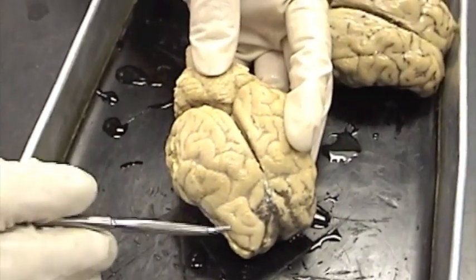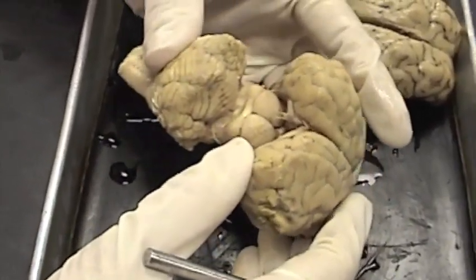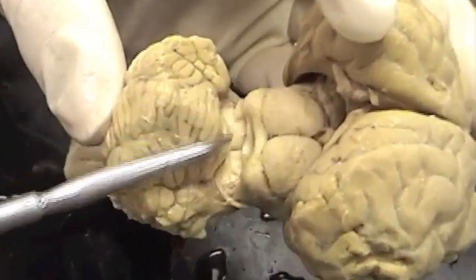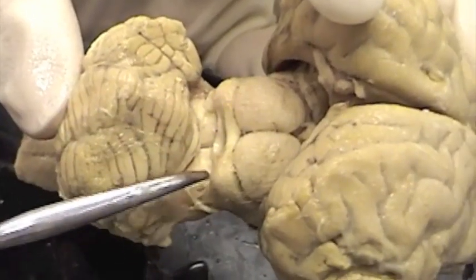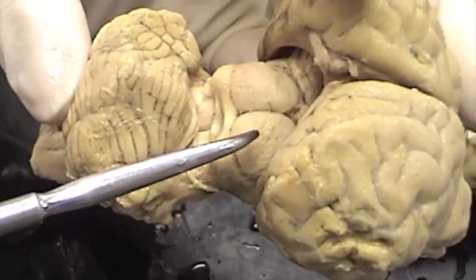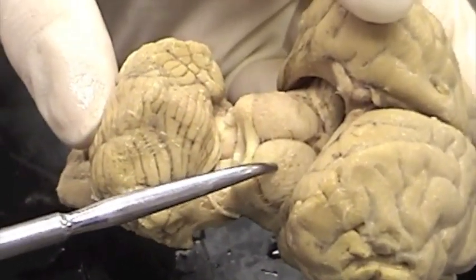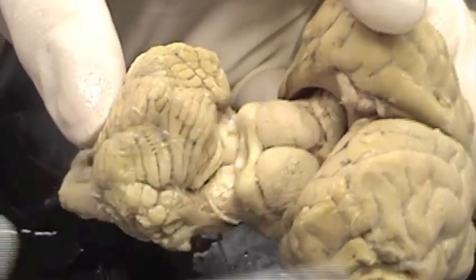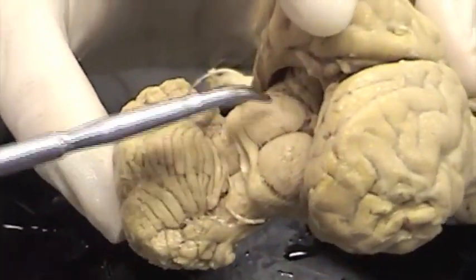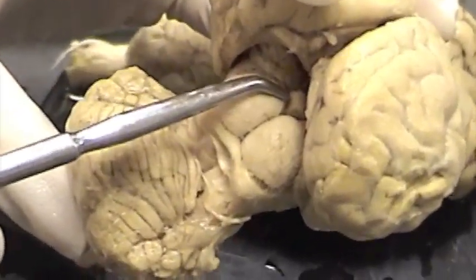On the dorsal side of the brain we find some other important structures. I am going to bend the brain, separating the cerebellum from the cerebrum, to expose four bumps. All four of those bumps together are known as the corpora quadrigemina, which is made up of two superior colliculi and two inferior colliculi. There is one further small bump right here — that small one is the pineal body, also called the pineal gland.